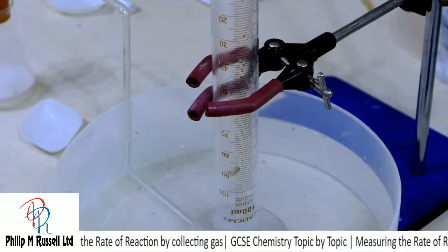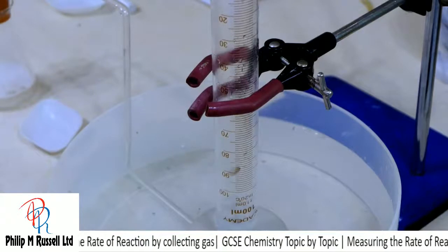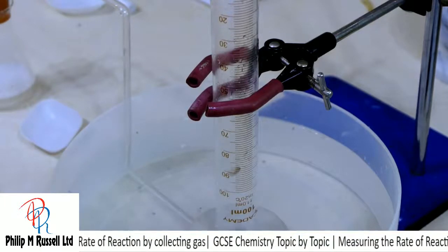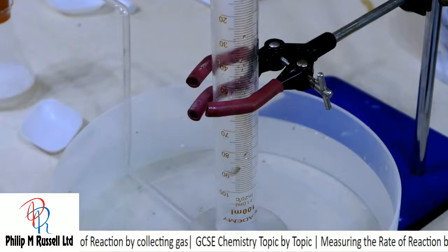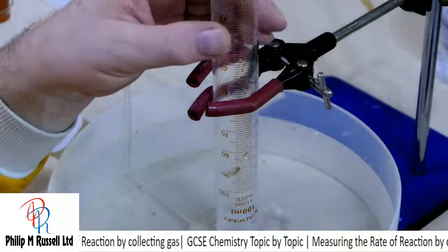And 40, we're bust, and we're going along collecting all our carbon dioxide. And that is the end of this experiment.